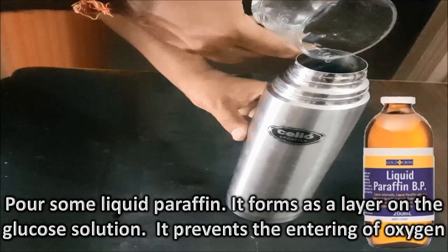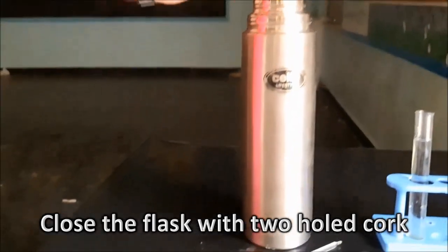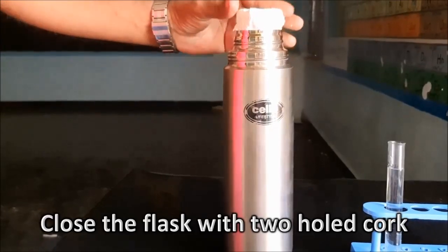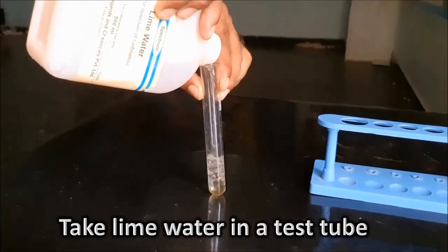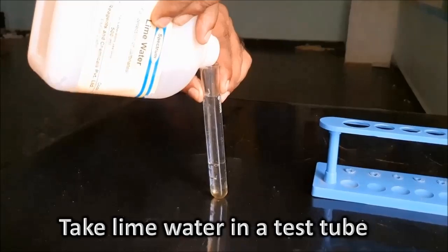Close the flask with a two holed cork. Take the lime water in a test tube and keep it in the test tube stand.